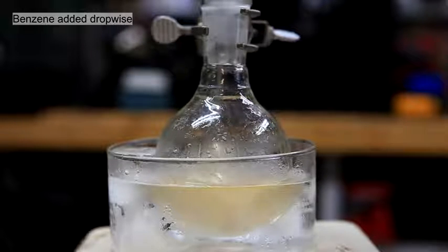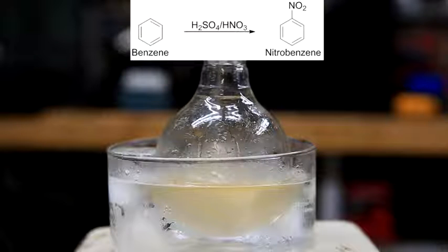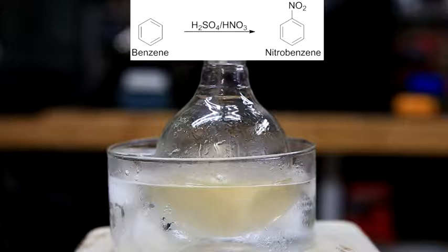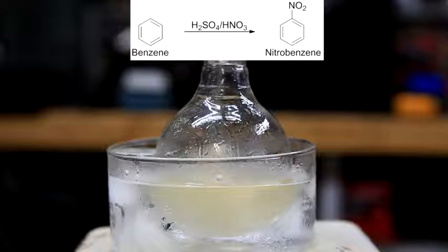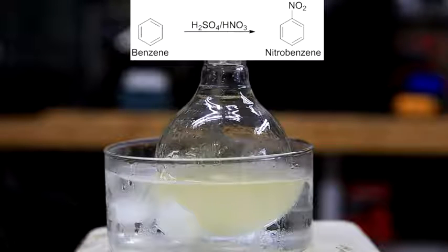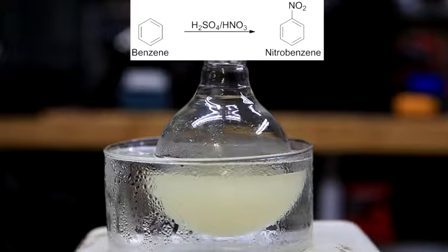The reaction that we're carrying out is shown above. The mixture of sulfuric acid and nitric acid allows for the nitration of benzene to produce nitrobenzene. Because our goal is only to nitrate the benzene once, we keep the temperature low in order to prevent the dinitration and the trinitration of the benzene. This is not only for yield purposes, but also for safety, as the di and trinitrobenzenes are actually explosive.